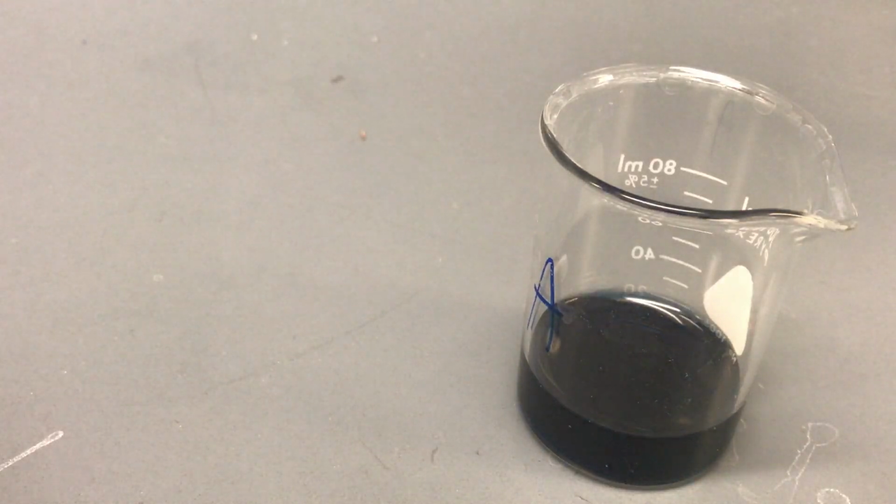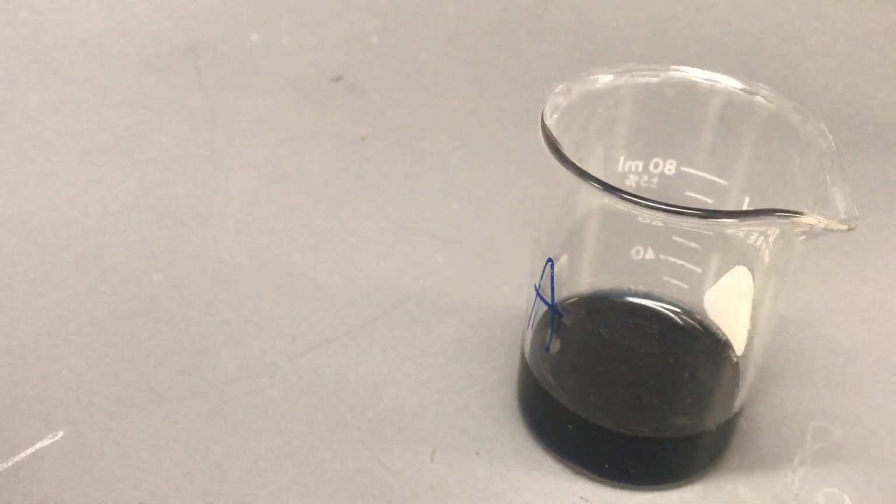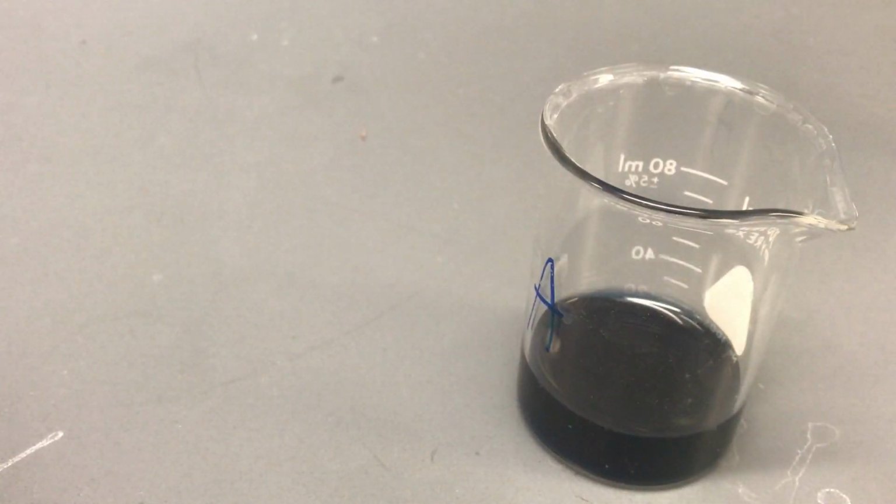And notice with the smallest concentration, it took the longest time. So that again is the iodine clock reaction relating to rates of reaction and how that correlates with concentration. This one had the lowest concentration, and think about it, it actually took the longest time. Just by viewing it, hopefully you went through. If you need to go back and just forward to the spots, you can look at the timelines where the initial pour started and where the colors changed.